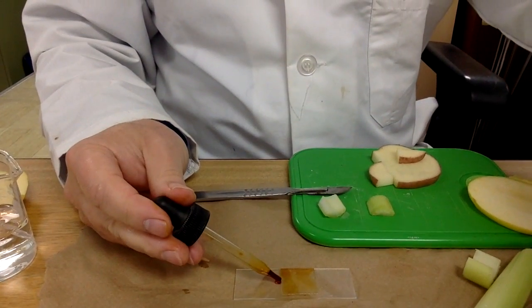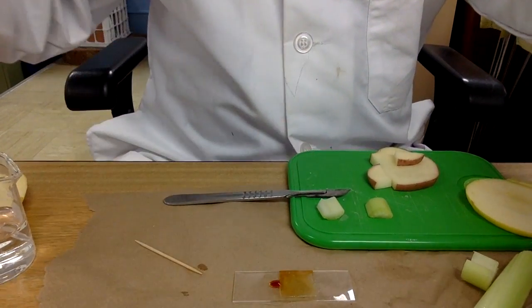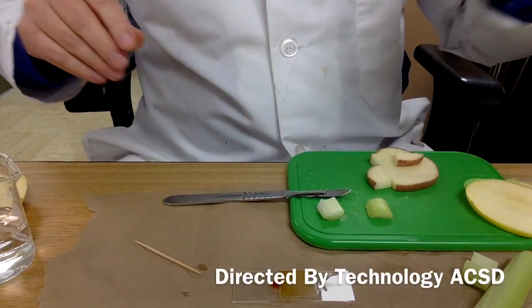Use a cover slip. And I'd suggest putting some iodine underneath that cover slip. Again, help draw it through as necessary and get a look under the microscope.